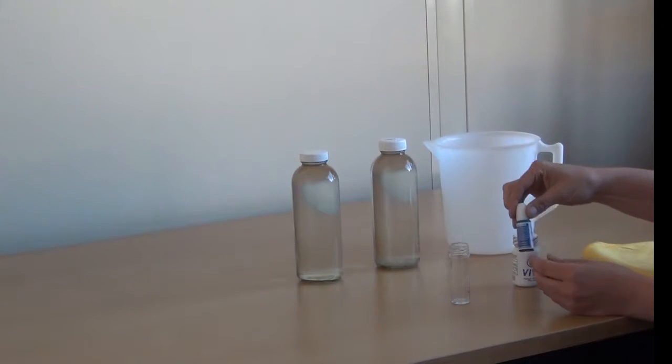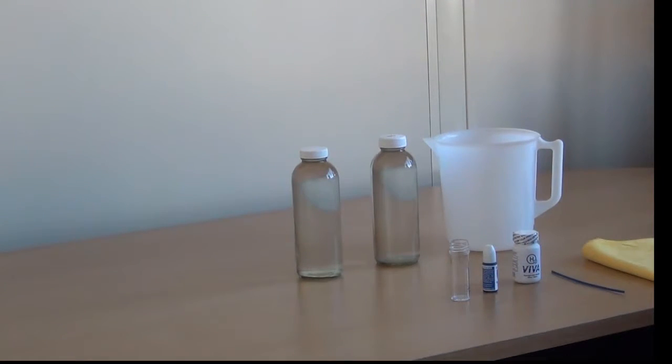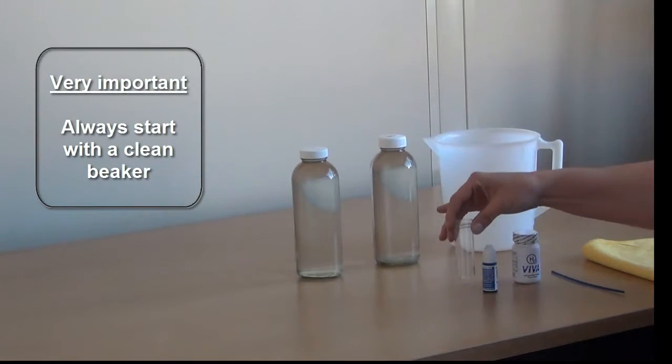Then repeat that procedure for each drop that's added. When testing the hydrogen level in the water always start with a clean beaker.